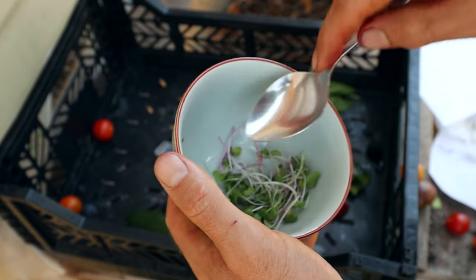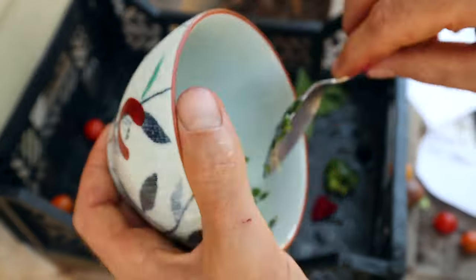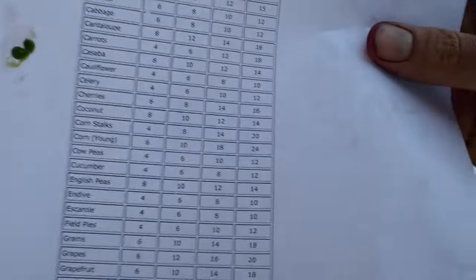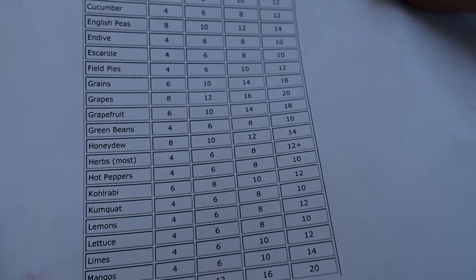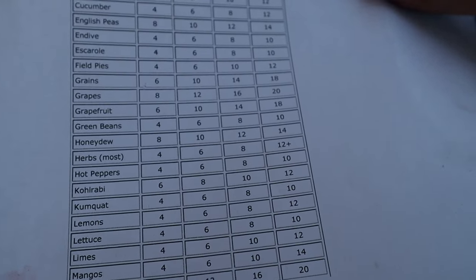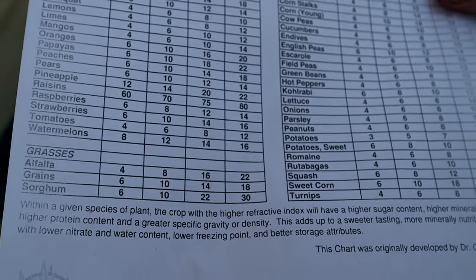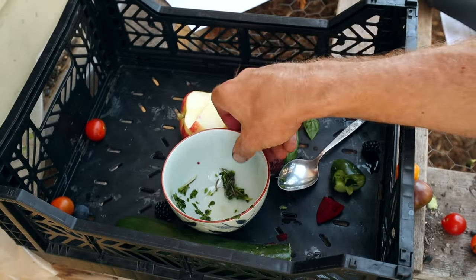The last few things I'm going to smash up to try to get the juice out. Let's try some microgreens — there we go, that's at about 4. I don't have microgreens on my list here, and that was a bunch of different varieties so who knows. Lettuces: a poor would be 4; endive is also 4 for poor. My microgreens are awesome so I don't really know what to say about that — microgreens are supposed to have an insane amount of nutrients. I'd love to cross-reference this Brix reading with an actual plant tissue sample.